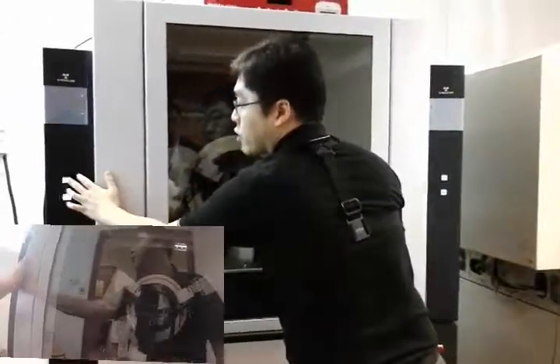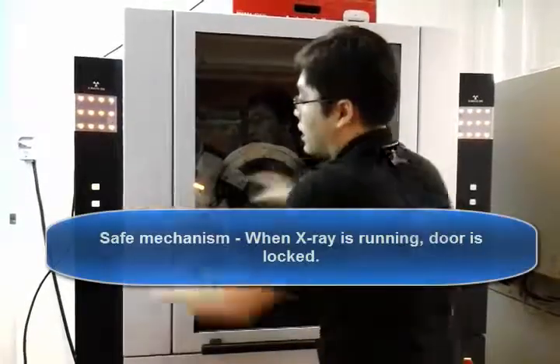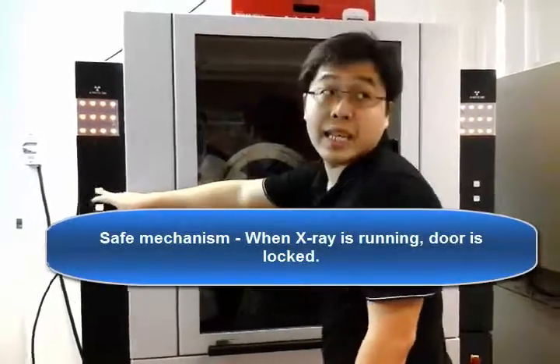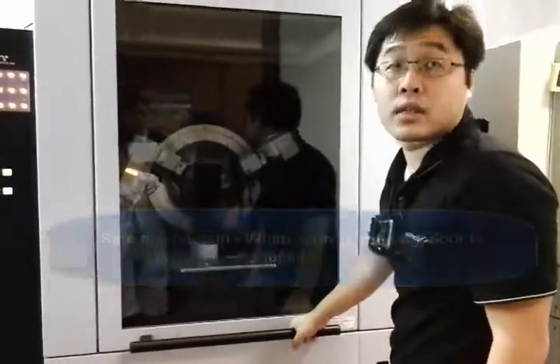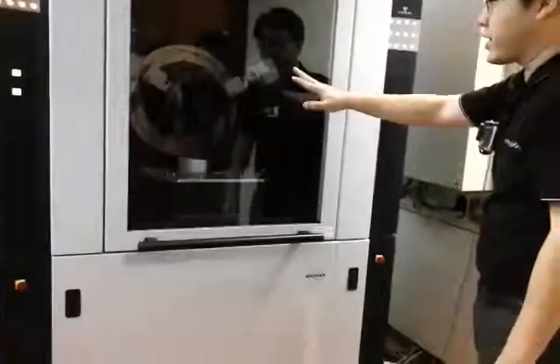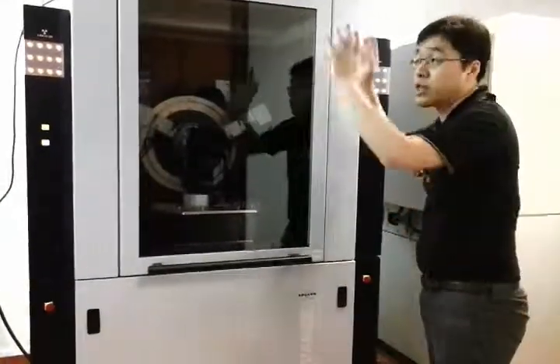When the X-ray is turned on, the lights will turn back on and give a radiation yellow color, so you can't open the door for safety reasons. These two here are the E-stop buttons — in case of anything you need to stop immediately, you just hit this and the whole thing will shut down.